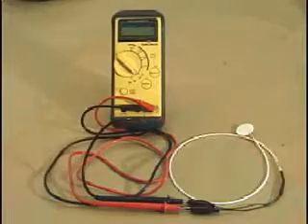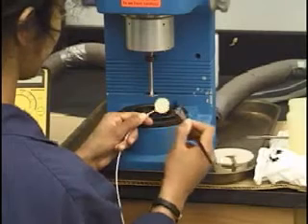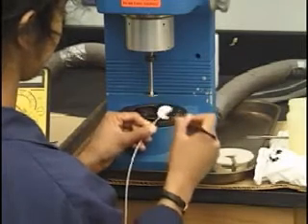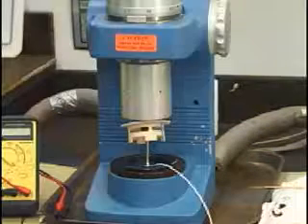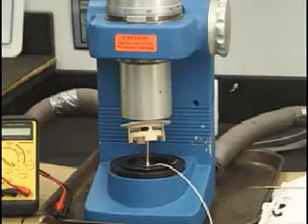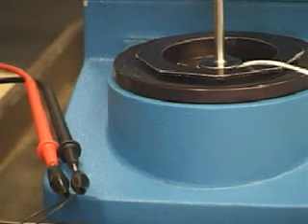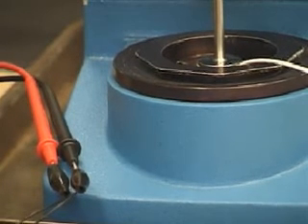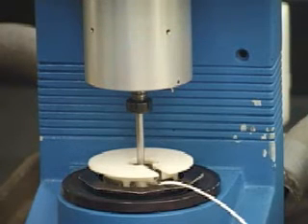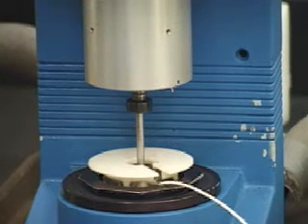The temperature is calibrated using a thermistor and multimeter. Coat the thermistor wafer with petroleum jelly to ensure good thermal contact. Position the thermistor wafer between the plate and spindle as shown. The thermistor should be held snugly between the plate and spindle. Connect the ends of the wafer to the multimeter. Lower the plastic cover if necessary and make sure the thermistor wafer is covered by water.